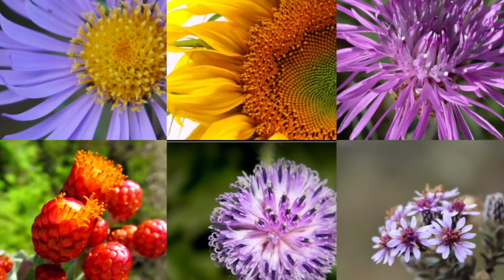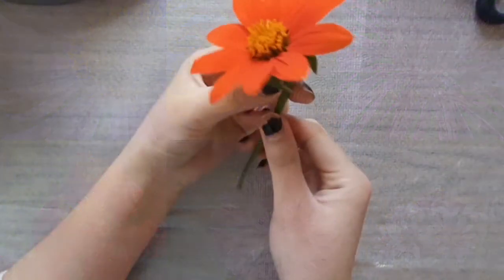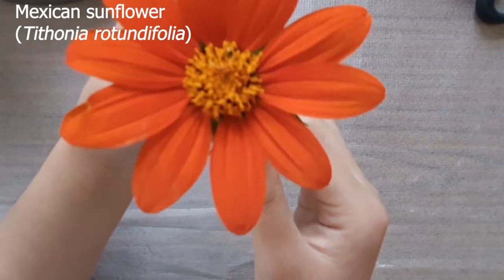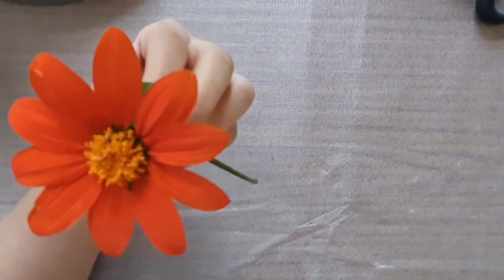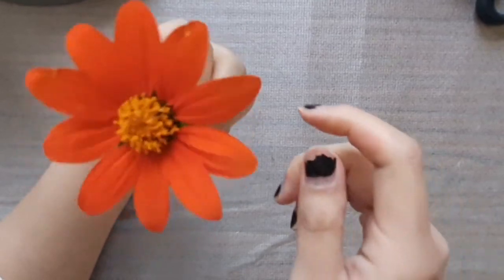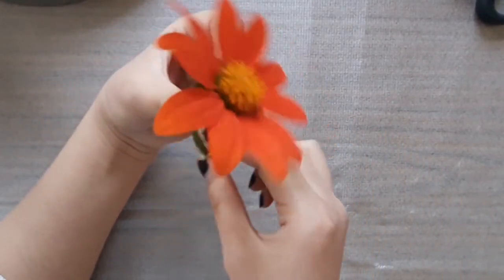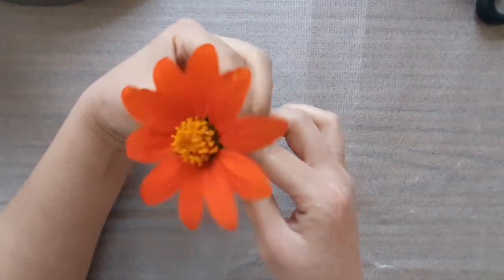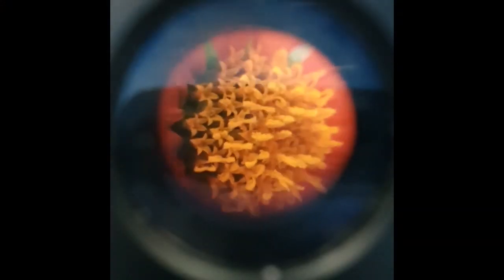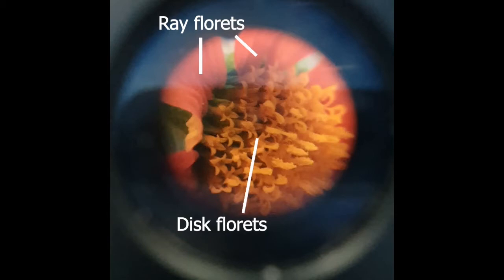In this video, we'll look at some dissections of composite flowers. First, let's look at this Mexican sunflower. It has a head inflorescence composed of many small florets gathered together. The ones on the outside have showy petals and they're called ray florets, and the ones in the center are smaller and called disc florets. Those are the ones that have the seeds.